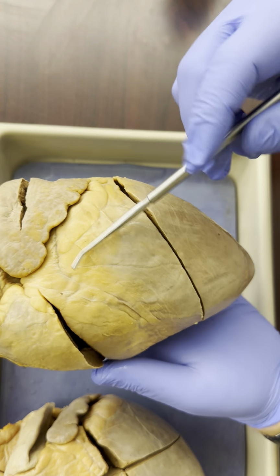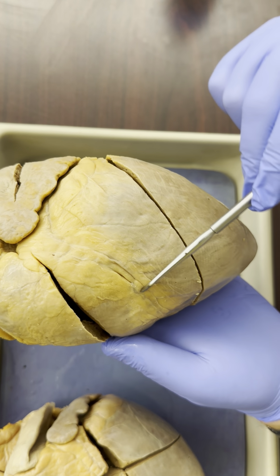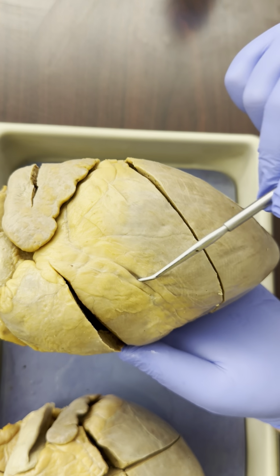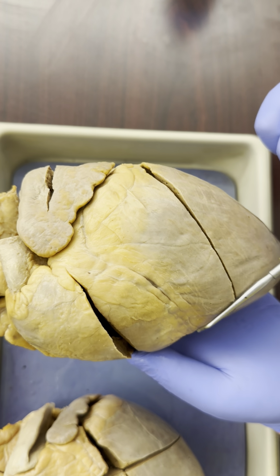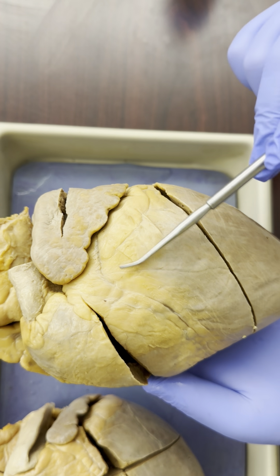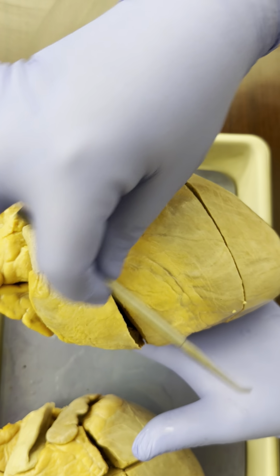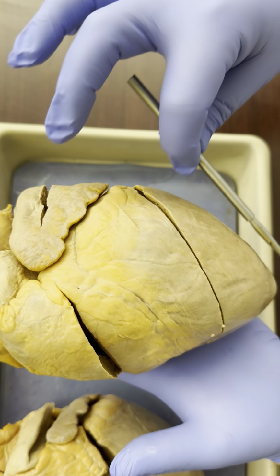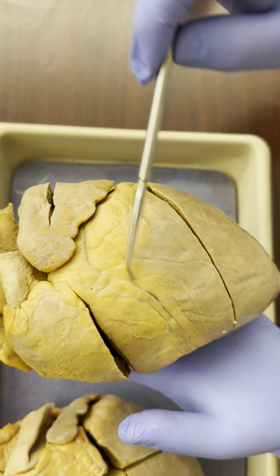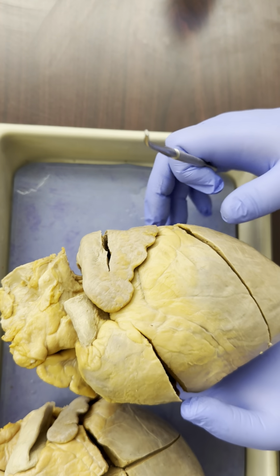And here it's very faint, but there is a blood vessel that runs down through this portion of the heart. It's surrounded by some fat, some other connective tissue. This is the coronary artery, and this separates, for the most part, the right and the left ventricles. So everything kind of diagonally in this direction is the right, and everything diagonally in this direction is left. So this is also on the front of the heart, the anterior side of the heart. So now I've oriented myself. I know all the directions of the heart.